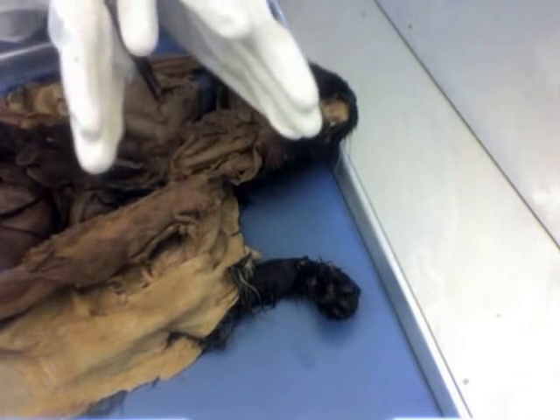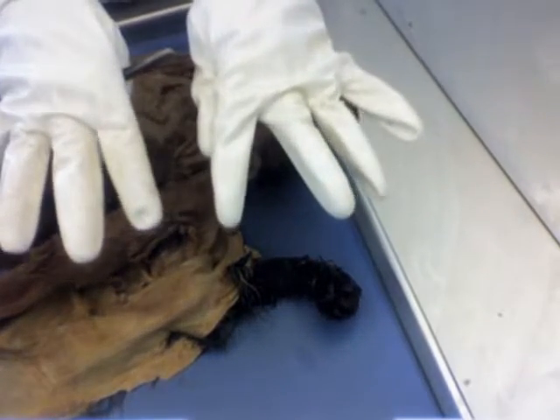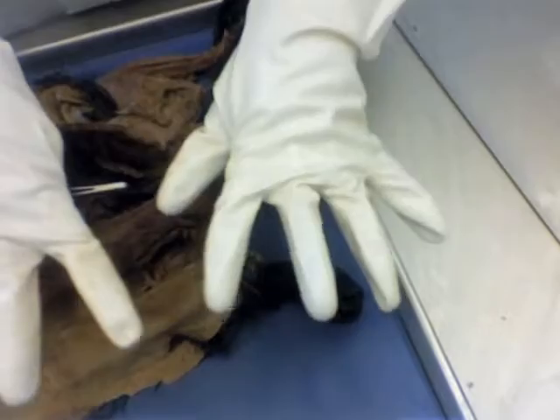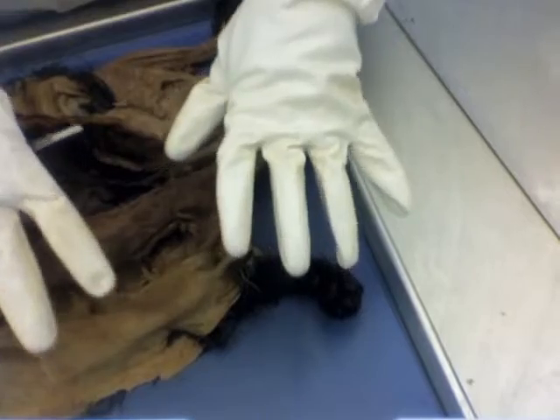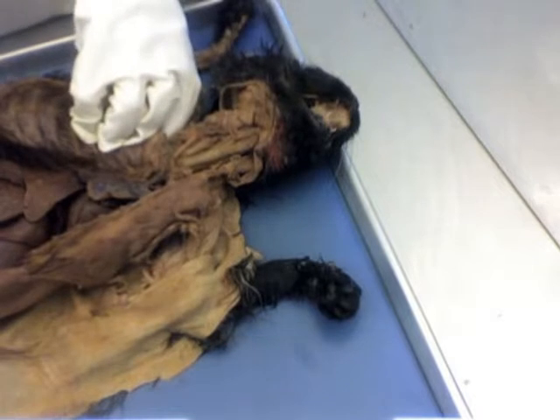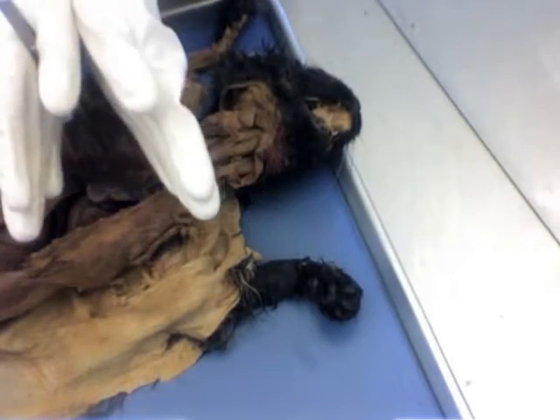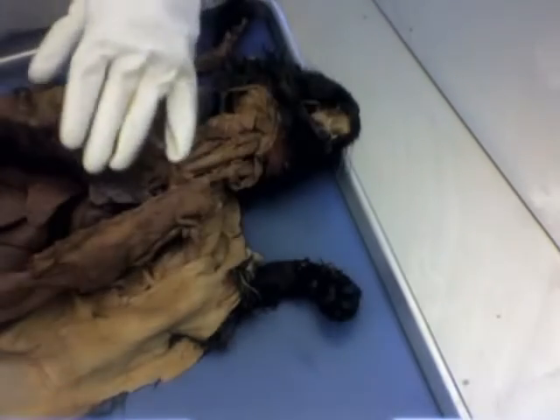That first division is the primary bronchi. Then those primary bronchi are going to divide again, and those next divisions are the secondary bronchi, and then finally those are all going to divide again, and that next division, those are called the tertiary bronchi. I'm not even going to try to explain that on the cat here, but you would benefit from looking at a model or simply getting a Google image of that. As long as you understand that concept: we have our trachea, first division, primary bronchi, next divisions, secondary bronchi, and then the divisions off of those are the tertiary bronchi.